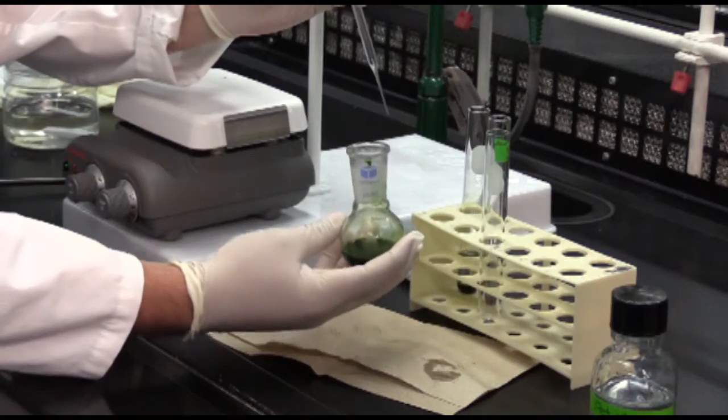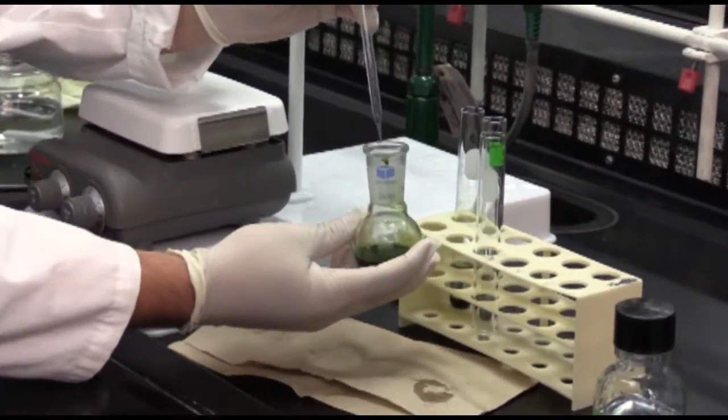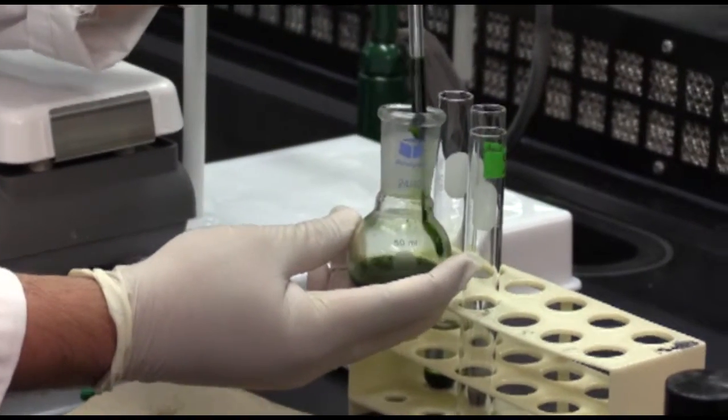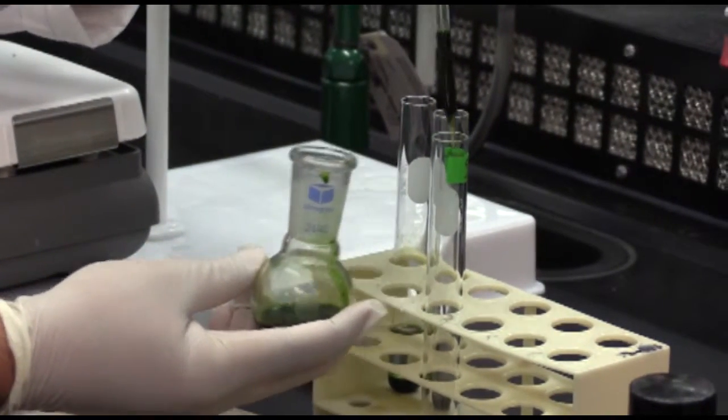Now grabbing your round bottom flask, you want to transfer your solution to the test tube.